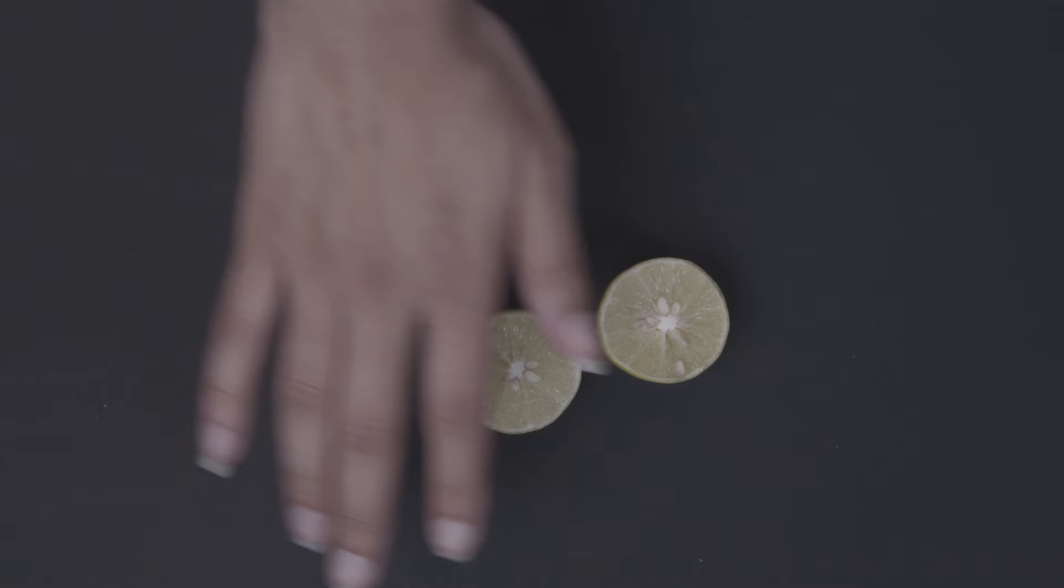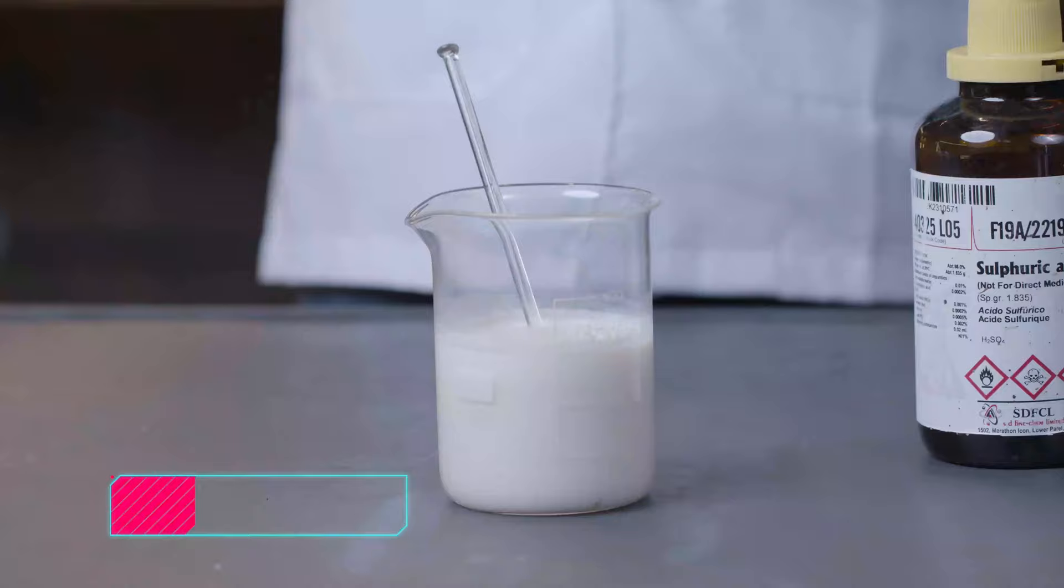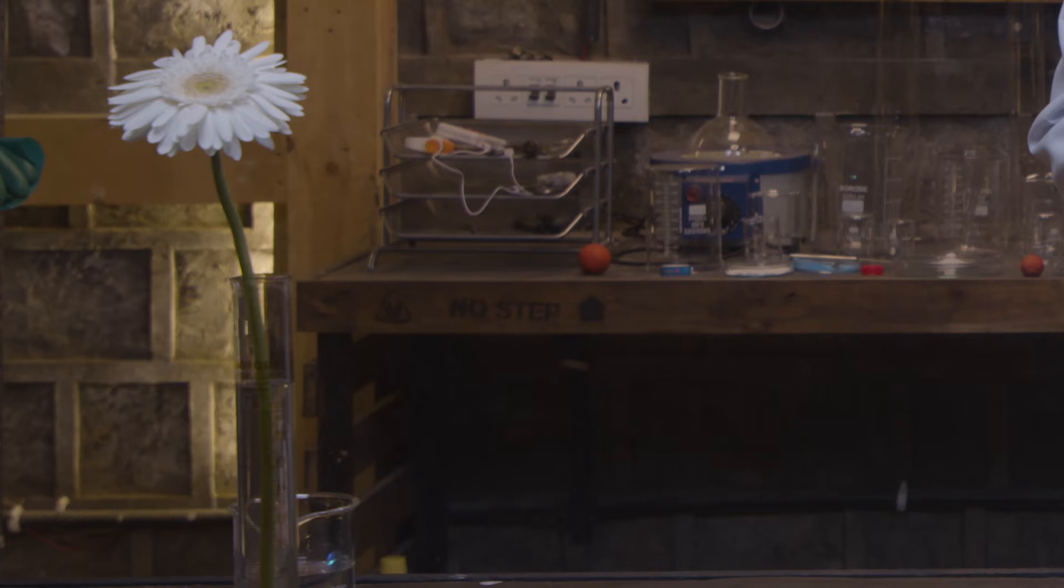Welcome back guys! Welcome to my lab. In the first episode of sulfuric acid, you guys saw how we experimented with various things like milk, lemon, and chicken. That was fun, wasn't it? So let's try something else today.